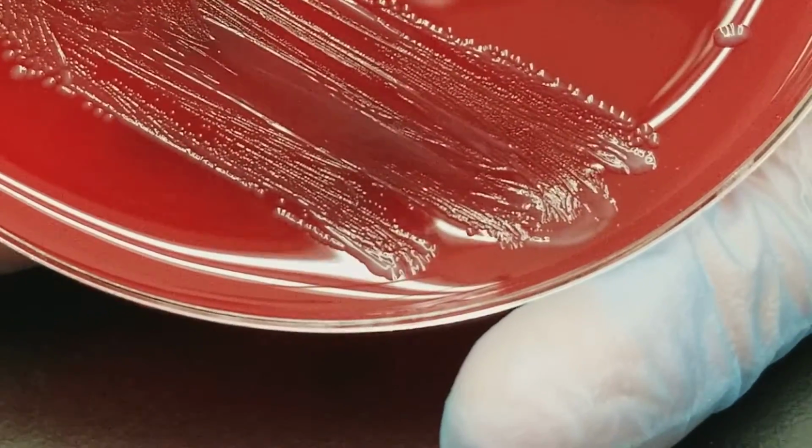This time, we're going to be looking at what pathogens actually look like. Unfortunately, these are not going to be cultures that are from an actual specimen with anything else that might have grown. This is actually purified cultures. So this is a pathogen from, where is it from?